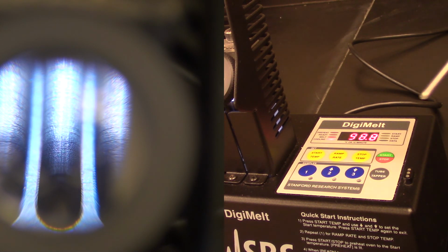That is it. If you have any questions on how to use it during the lab, then your lab instructor or lab assistant would be more than happy to answer any questions that you have. And so we are good to end the video.